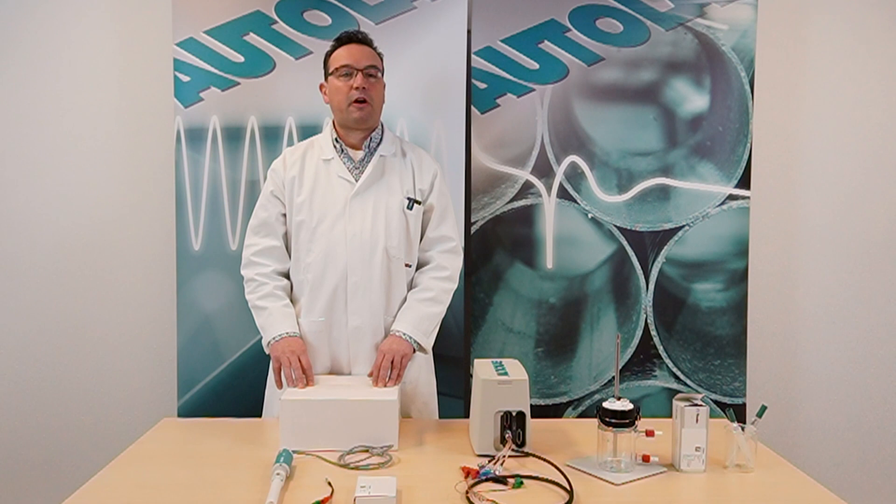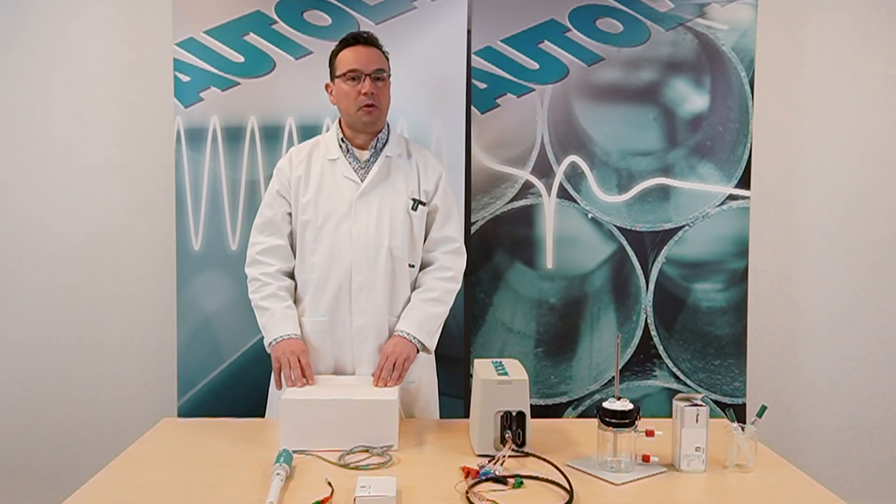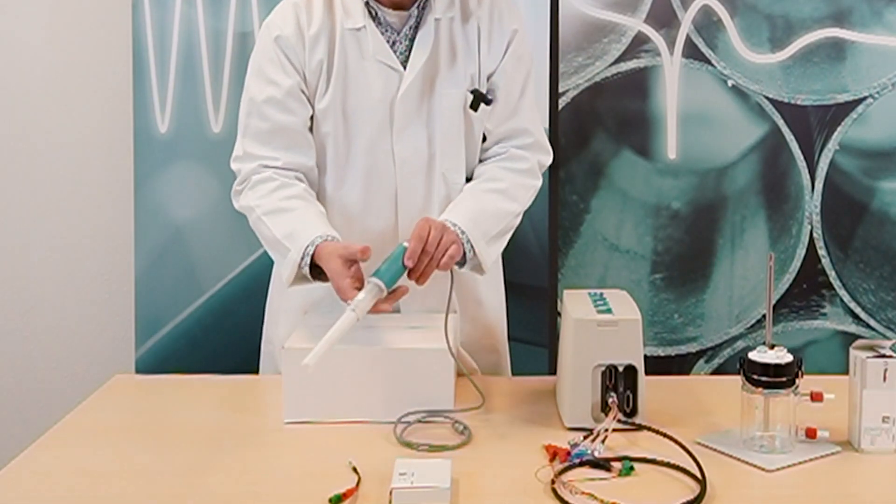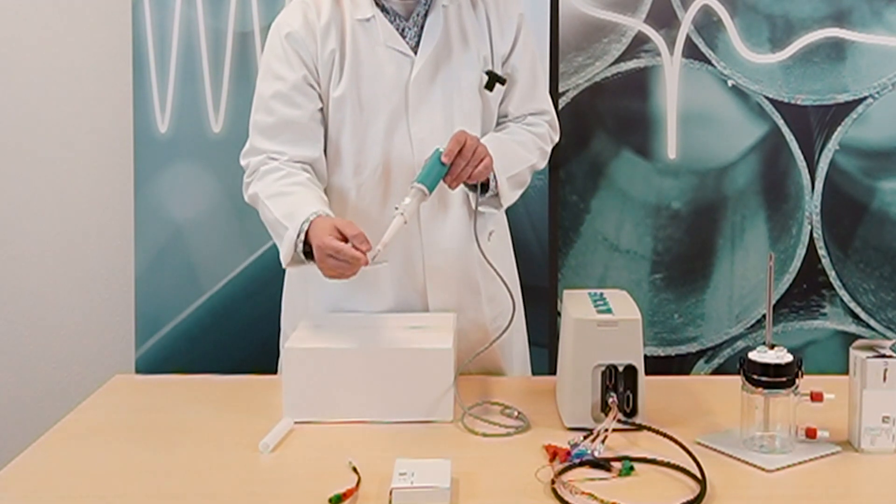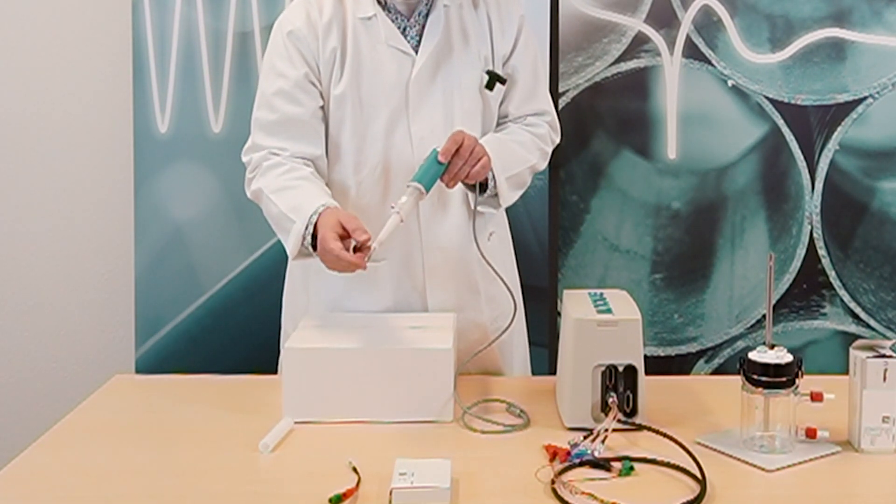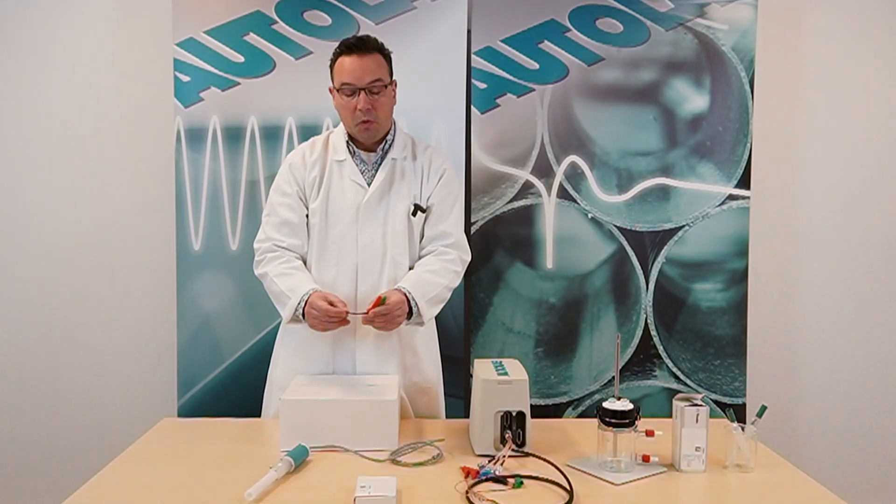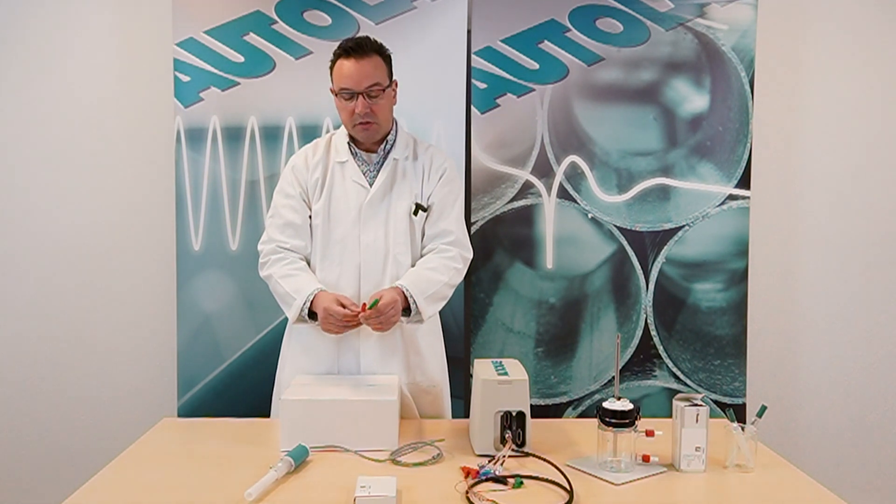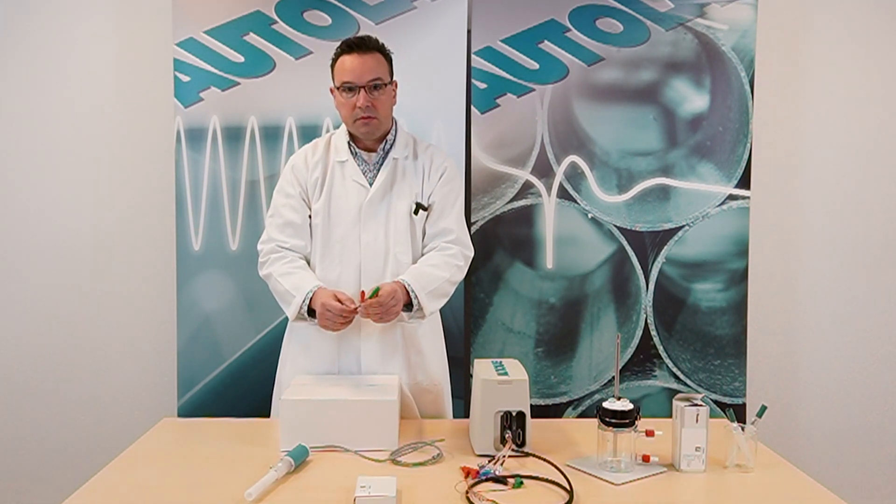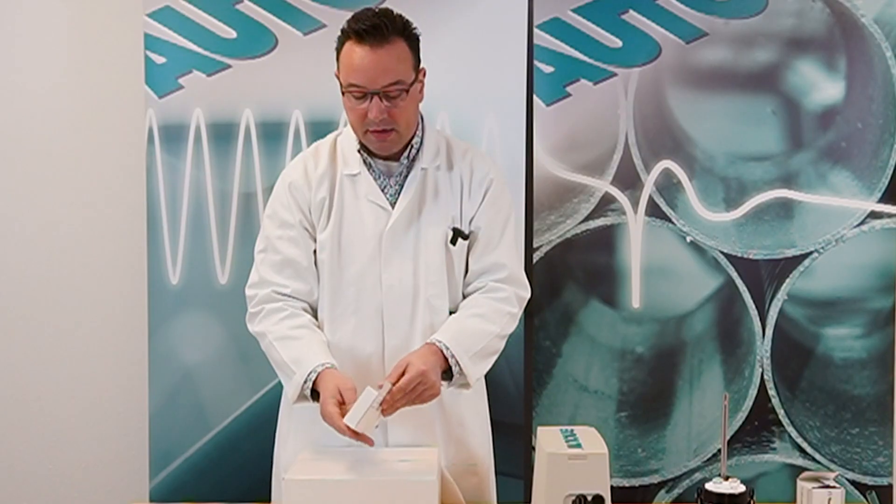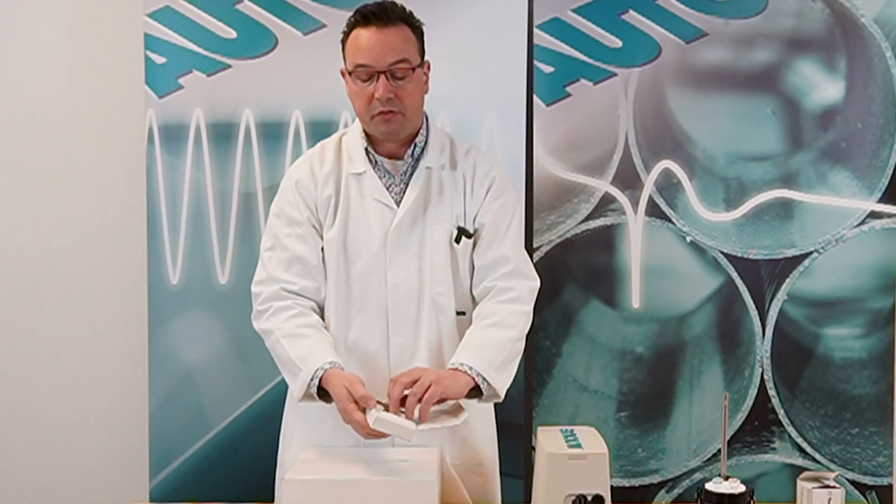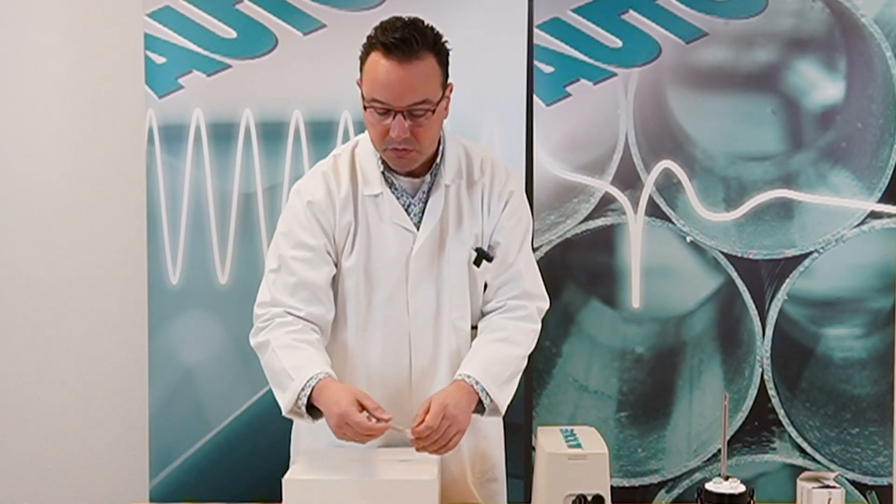The standard RDE 2 comes in two boxes. One containing the motor controller and the other containing the rotator. The rotator has a protective Teflon shaft to protect the axle from bending. The two-way electrode cable is for the working electrode and the ground connection. With this cable you connect your working electrode and the green ground cable coming from the potentiostat. And the next box is for the 3 mm platinum electrode tip.